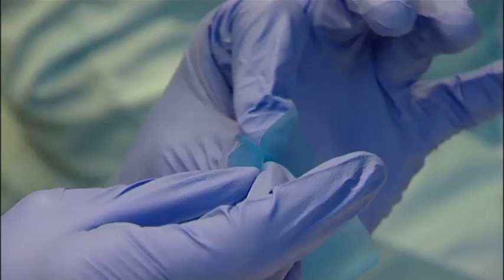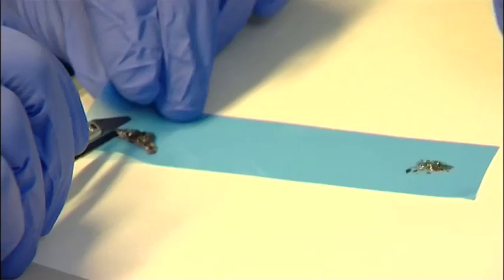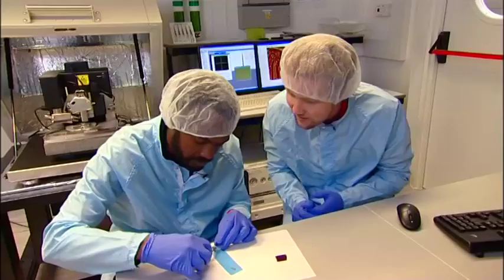So if you look there — it's tearing it off. It seems to be quite different in different places, it's not an even layer. No, it comes off in terraces. So we just remove the excess graphite like this.